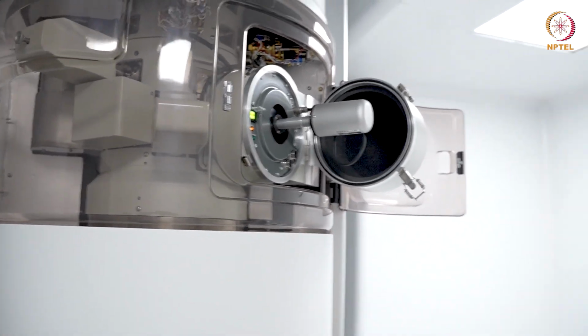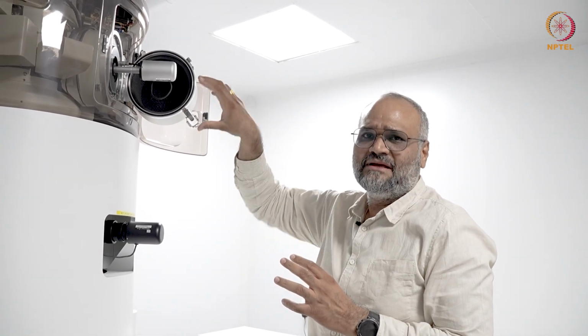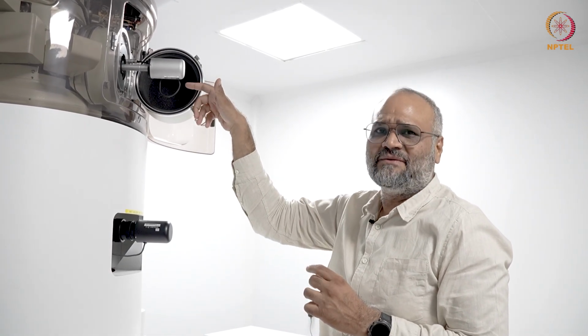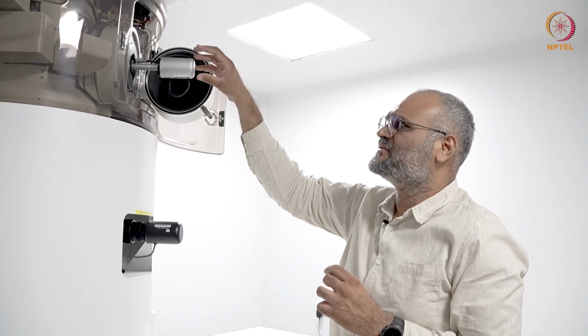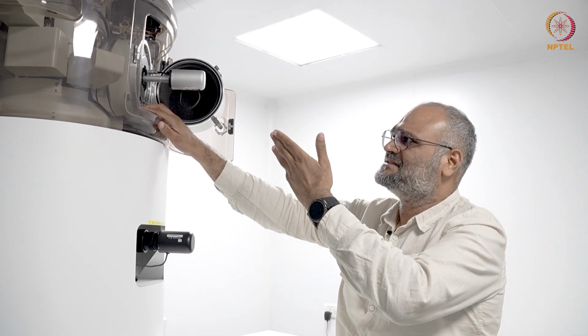I should wait till the green LED goes on, and then the first step is I turn the holder in clockwise direction by approximately 15 degrees. It goes in by one step, and then I turn it again further by 75 degrees. While it is being turned towards 75 degrees, I have to hold the holder carefully, because now it is actually pumping in the airlock chamber here.